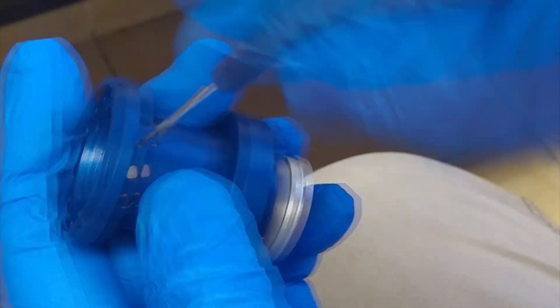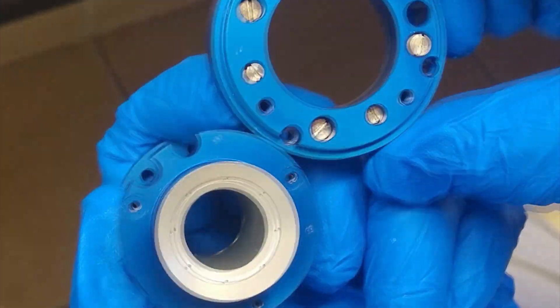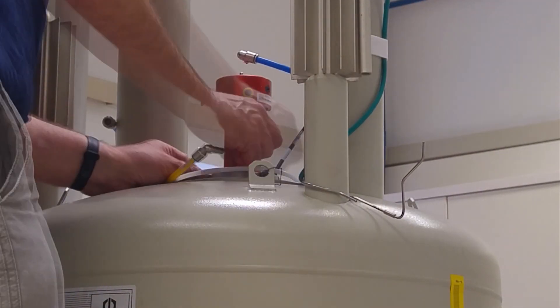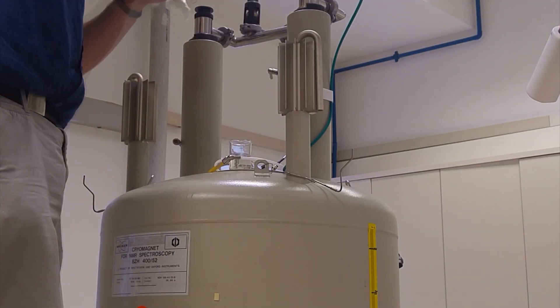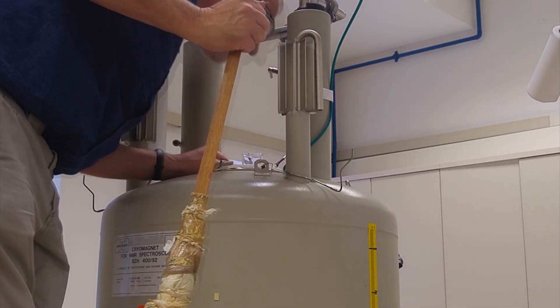Return the flange and tighten the grub screws. Return the outer ring and close the screws, then tighten the spacing screws. Reattach the turbine to the shim coils. Remove the remaining supports for the sample changer while detaching the pipe and connector to the upper stack, then remove the upper stack. Now that the bore is open, it can be cleaned with a wooden stick with the end wrapped in paper and soaked in ethanol.